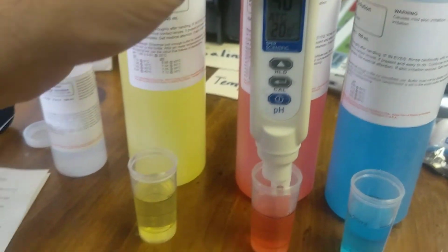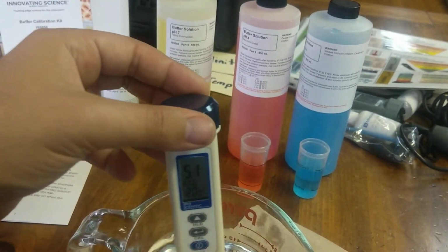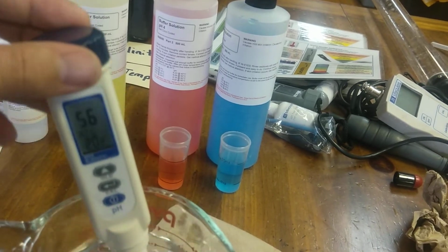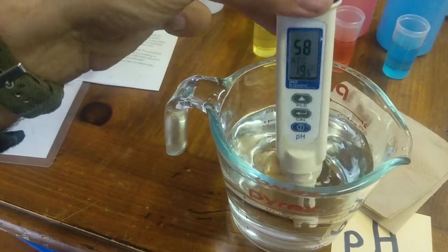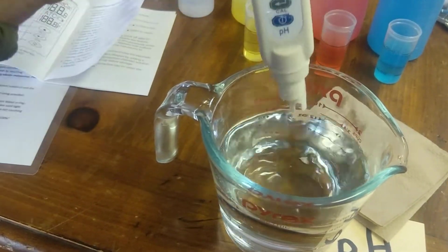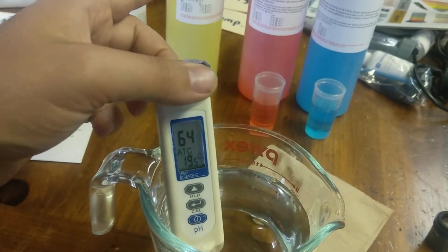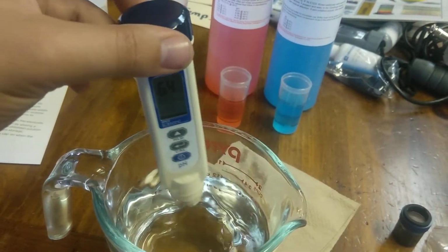Now you can just stop at that if you want, just do 2 point, which is totally fine. That kind of helps with things over here. If you want to go super accurate, do the last one. I'm going to show you that just because I can. So remember, make sure it's rinsed properly. Again, running water helps a lot, but again, making sure that pH 4 buffer solution's out. If you do leave some of it on and go to the blue, it's actually going to react and make it less than 10. And that is going to definitely affect the calibration you're doing.